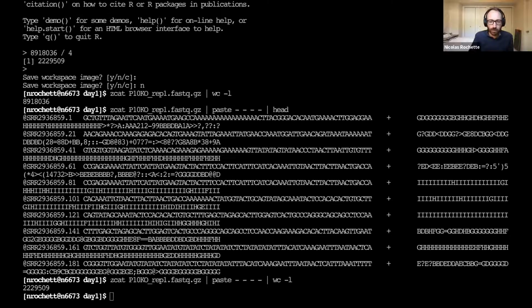So I think I missed the magic. I know you didn't really explain exactly what it does, but the last output that we got, is that for the last read? There's 4 reads, and I'm assuming they're not all the same length. Which output? Are we talking about this command here?